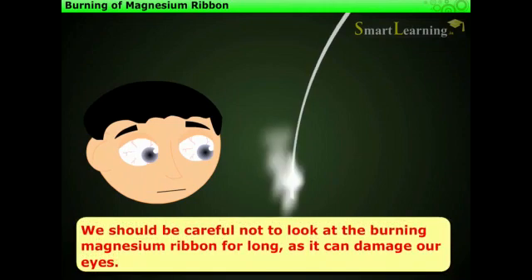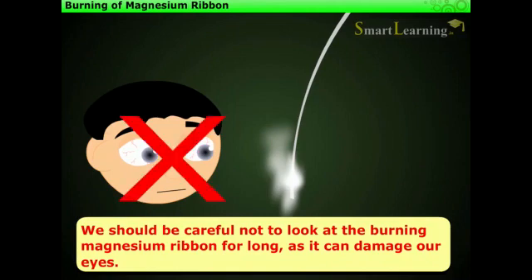Remember that we should be careful not to look at the burning magnesium ribbon for long as it can damage our eyes.